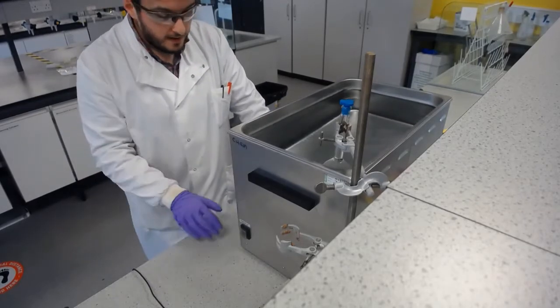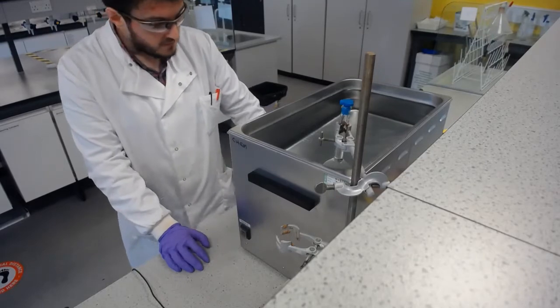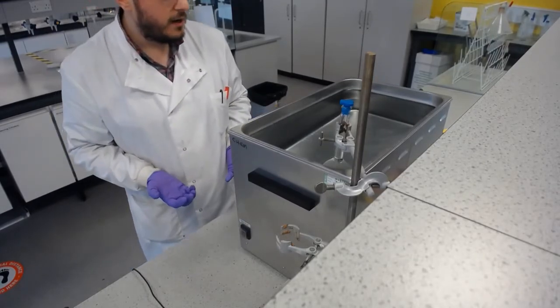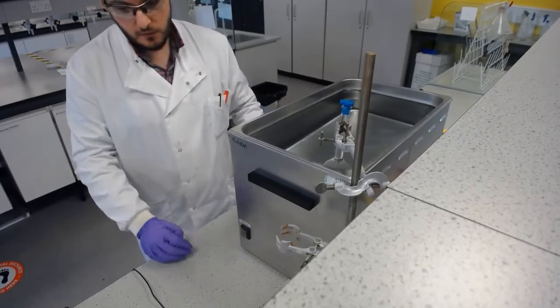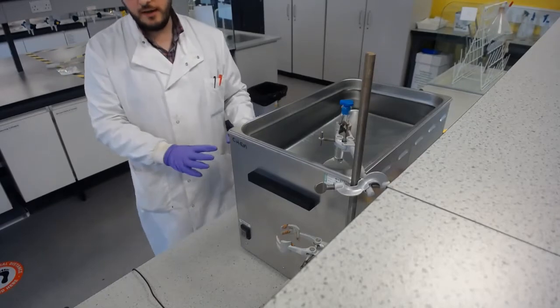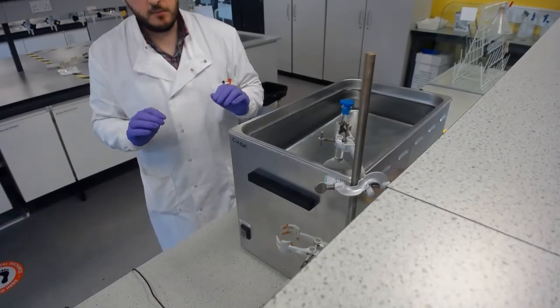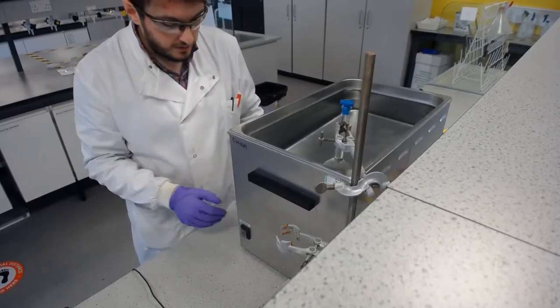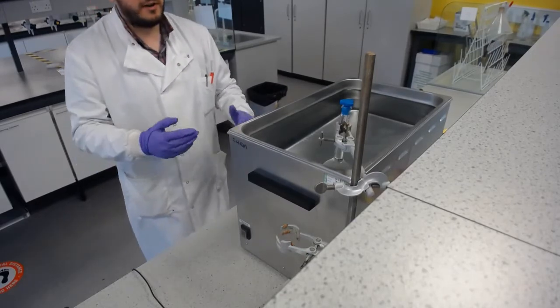So you put it in there and then you switch the dial on to turn it on. Now, they can also be heated because you may need to heat your sample to get it to go in, but when we're sonicating, if we sonicate for a long time, we might end up heating a little bit anyway. We're not going to heat this. And just bear in mind, we're using a low boiling point solvent. If we go for too long without monitoring it, we may find that we start to have the top popping off.